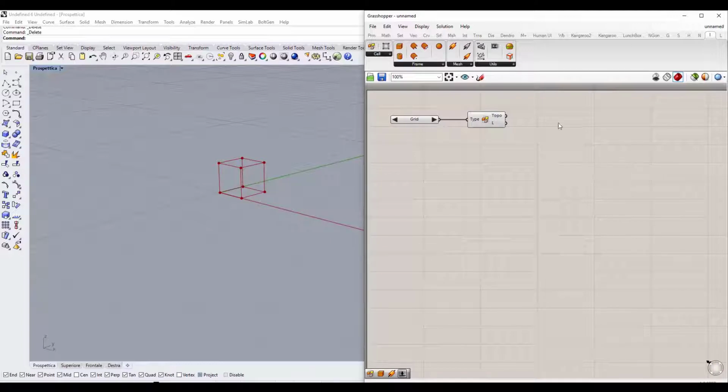If we click on this arrow, we can choose different types of elementary cells, such as X cells, star cells, cross cells, tesseract cells, Vintiles cells, octet, diamond, and so on. Now we can choose the global shape of our scaffold. Do we want to produce a cubic or cylindrical scaffold, or do we want to give our scaffold a spherical shape or any generic shape? Okay, we select the shape we want to give to our scaffold, for example, basic box for the cubic shape. We click on basic box and drag it into the main screen.